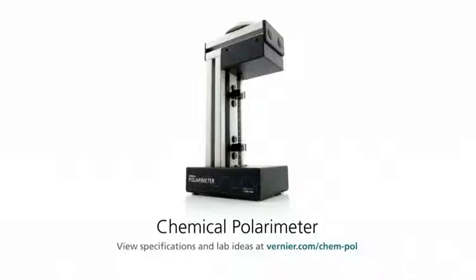A chemical polarimeter is a device for measuring stereochemistry of molecules and today I'm going to give you a brief introduction on how to use the polarimeter.